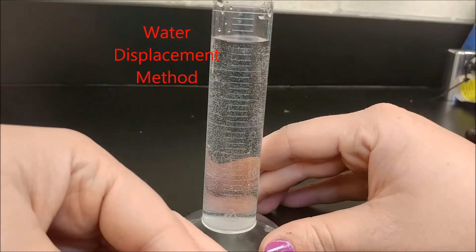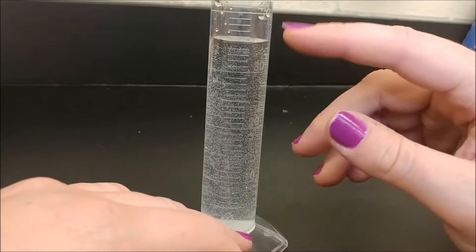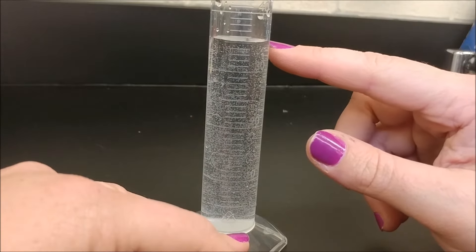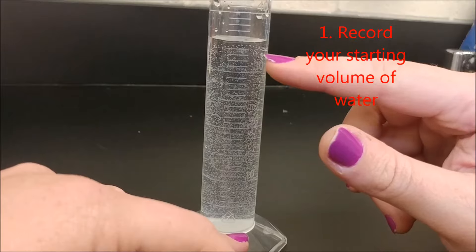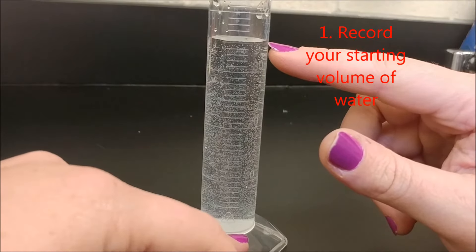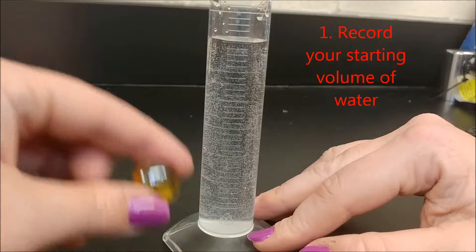I've filled my graduated cylinder with water. I've got it flat on a surface, I'm at eye level, and I'm going to measure to the bottom of the meniscus — it is at 35 milliliters. So I've got my starting volume of 35 milliliters.